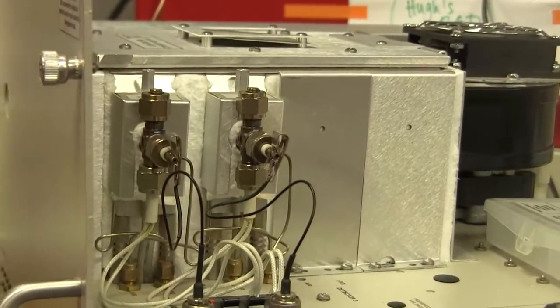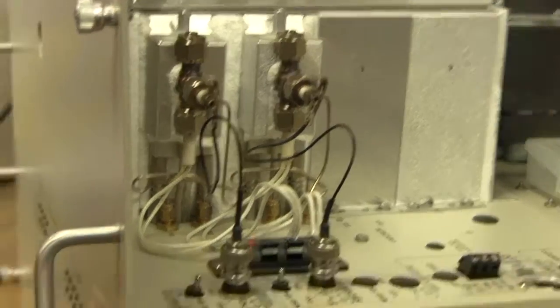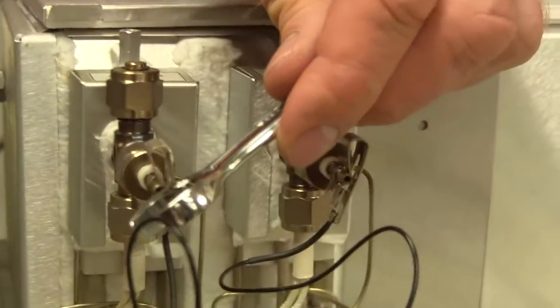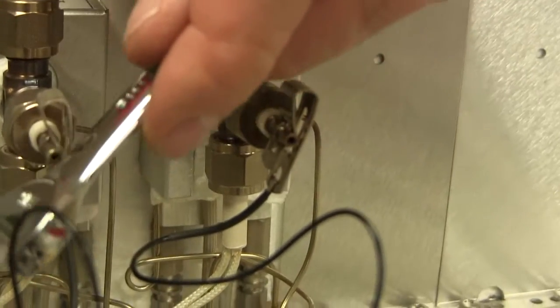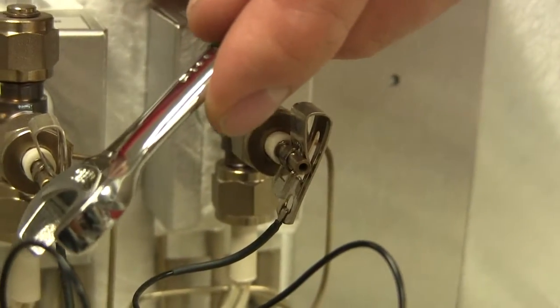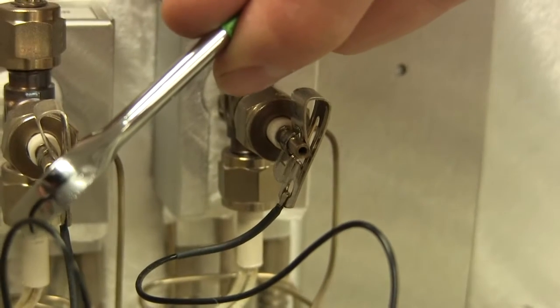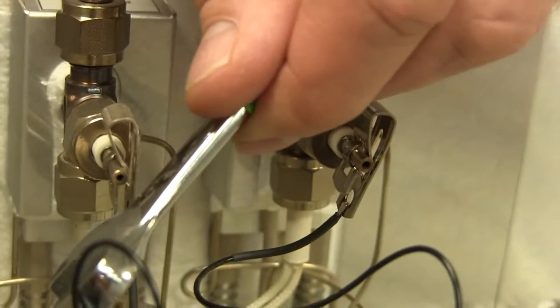Or, I don't have any peaks. And then we'll ask you, well, is the flame lit? So the way you know that the flame is lit is that you take a shiny object like this little wrench I have, and you hold it in front of the collector electrode, and you can see that there's a lot of water condensation appearing on this flat shiny wrench. So that FID is definitely lit. That's how you know. If you see the water condensation, then the flame is lit, because hydrogen and air, or oxygen in the air, combine to make water when there's a flame.